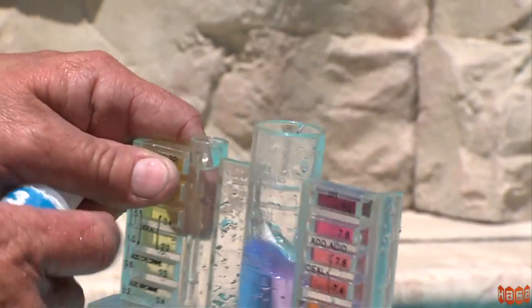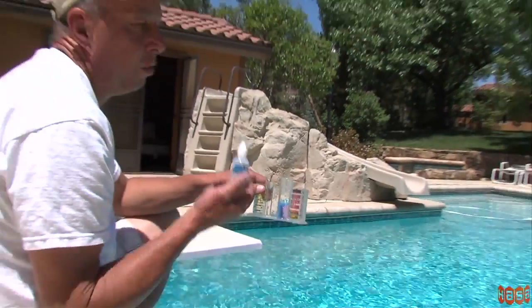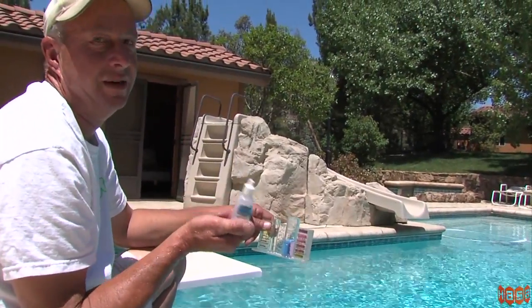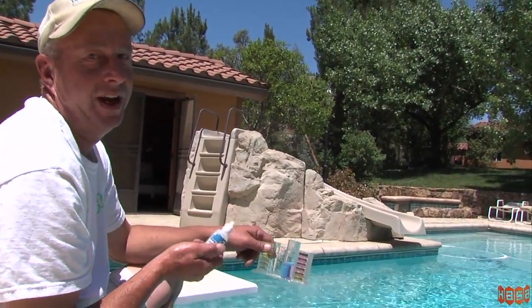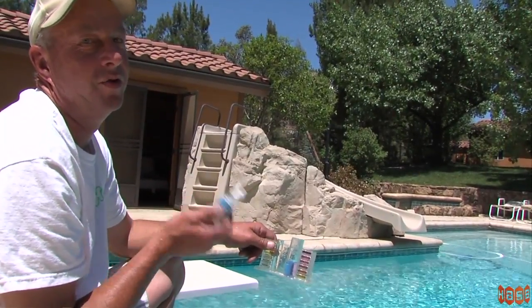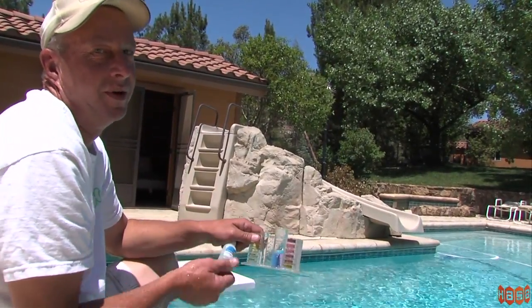I'm Mark from Autropic Pool. Okay, now we're checking the alkalinity level here. For every drop, you're going to times it by 10. So your alkalinity level should be between 80 ppm and 120 ppm, which is parts per million.